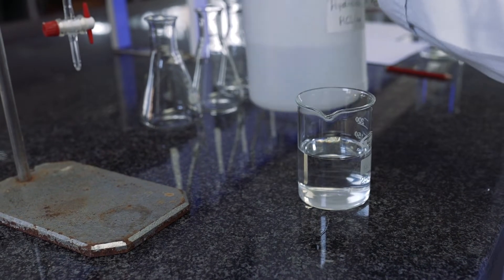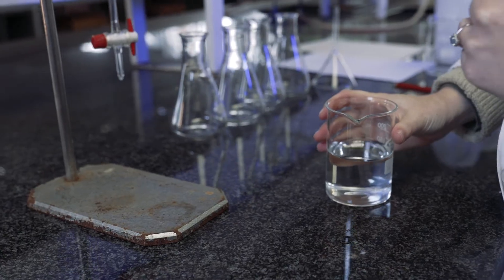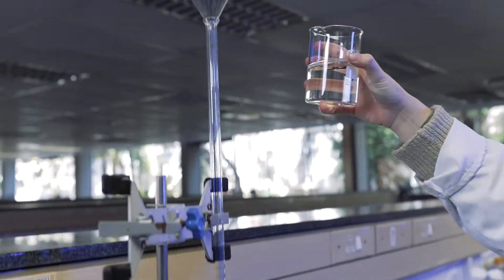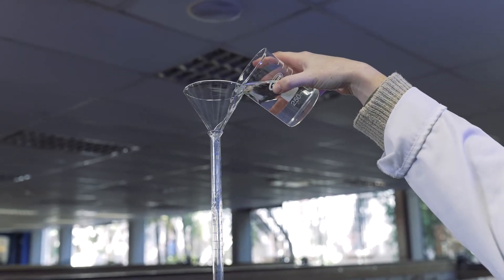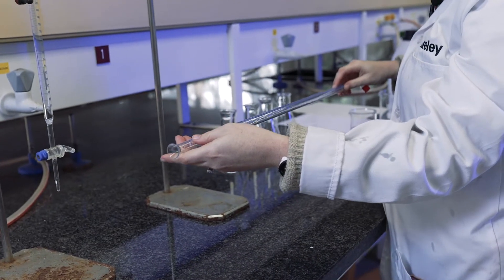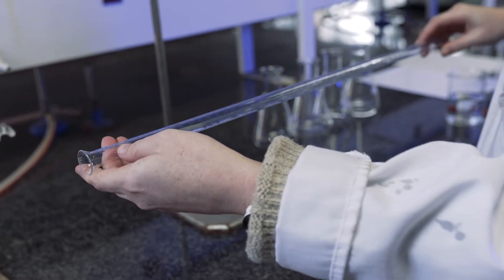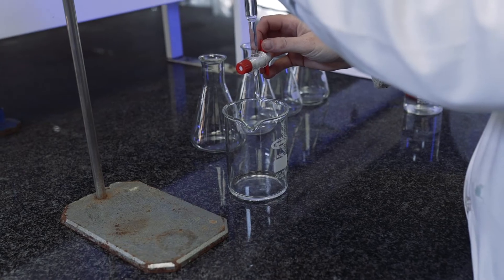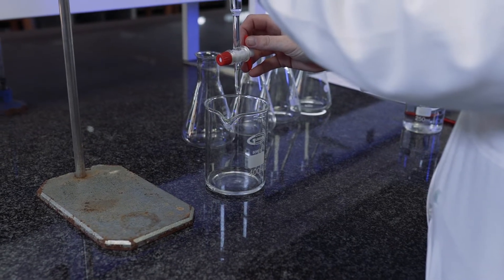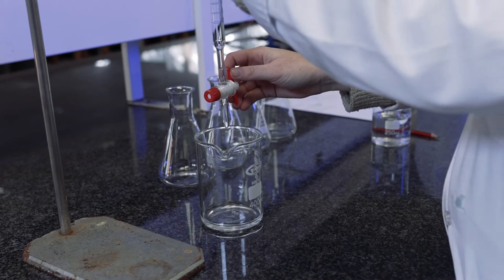This is sodium hydroxide because we're going to standardize it with our known solution of hydrochloric acid. Always make sure that the tap at the bottom is closed. Everything used to clean goes into our waste beaker. We can do it like this to make sure that no bubbles form, and then we just need to make sure we stop before everything runs out.